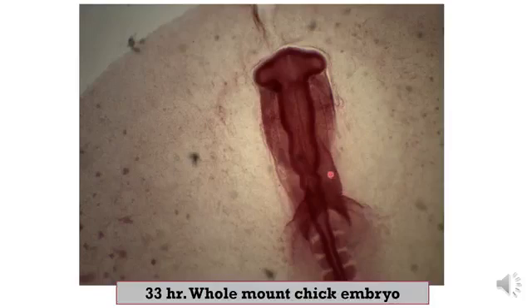This is the single heart tube, formed from anterior to posterior by the bulbus cordis, ventricle, atrium, and sinus venosus. This is the two horns of the sinus venosus. Okay, this is the heart tube, and these are the two horns of the sinus venosus.